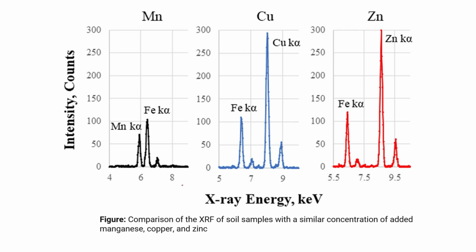So in this XRF graph, the author compares three soil samples, and they added similar concentrations of manganese, copper, and zinc. So we can see that in all three graphs, we have a similar iron K alpha peak here. So this means that the soil contains iron. Iron is here, iron is here, iron is here. The manganese peak, the copper peak, the zinc peaks are also available, but interestingly, the manganese peak is very low as compared to the copper and zinc.